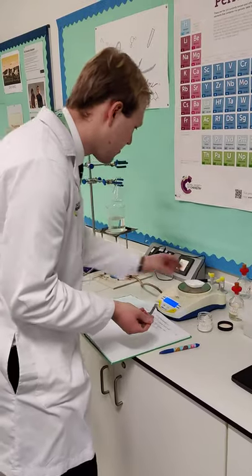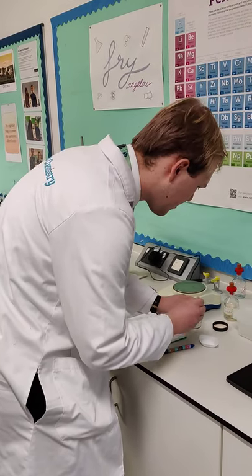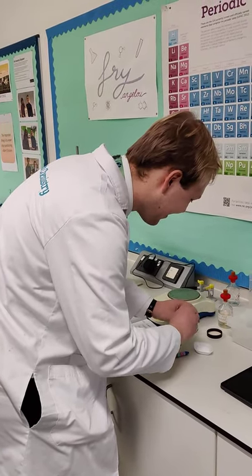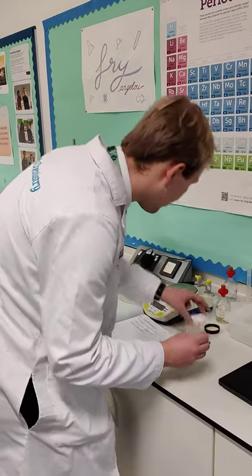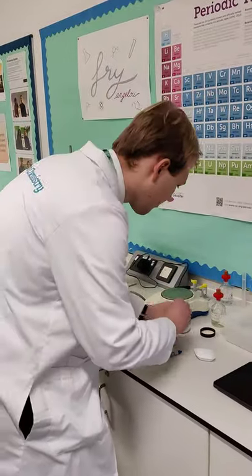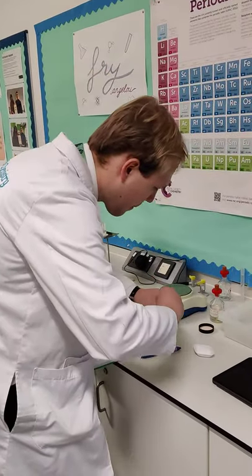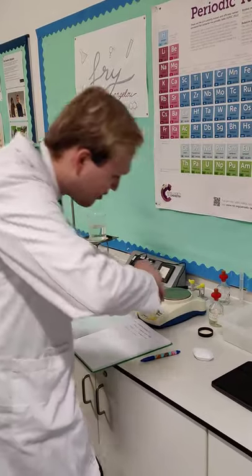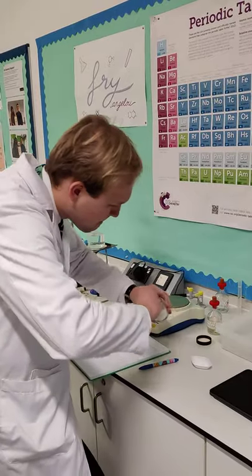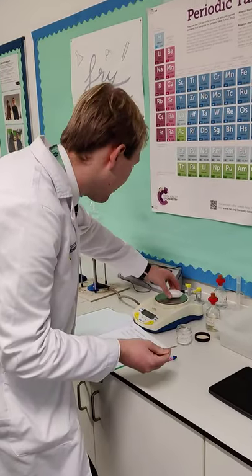That's a really good bit of advice. Still have a way to go. One of the key skills of being a chemist is the ability to scrape a solid from the inside of a jar. It would be great if I had a spatula — very handy. So at 6.70, this is including the mass of the weighing boat, which I forgot to tare. So that's 6.70 grams — that's the mass of the weighing boat and the salicylic acid.